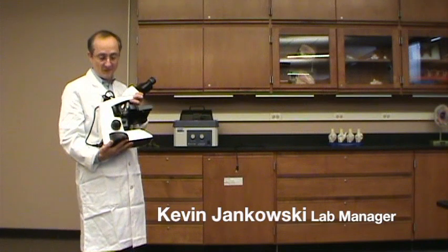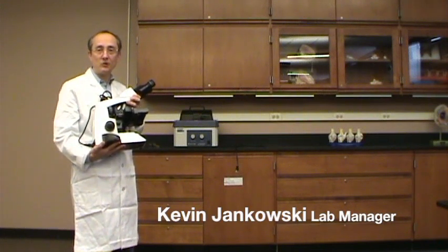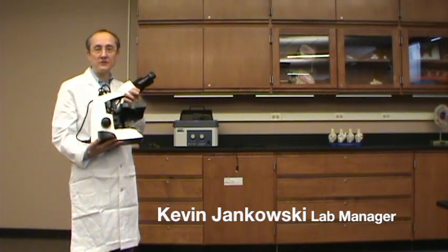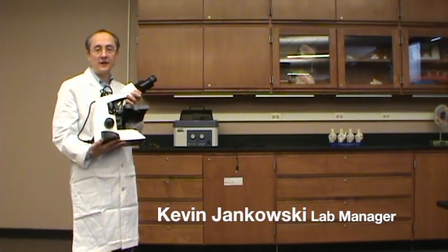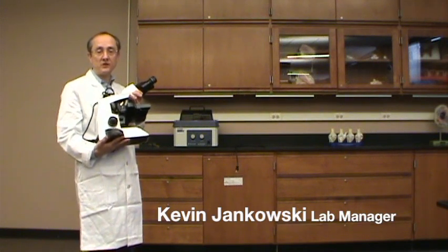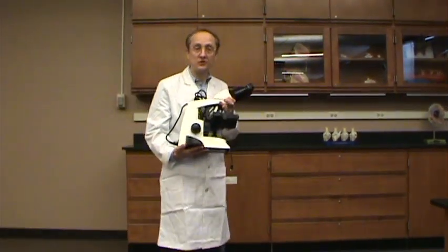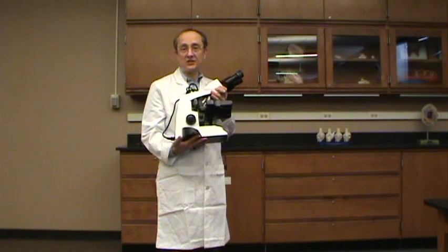Hello, welcome to Truman College's YouTube video on how to use the microscope. This is a compound microscope and it's a transmission microscope where the light focuses or runs right through the specimen. This is what we use in all our general biology classes and our microbiology classes, and I'd like to show you how to set it up and how to use it.